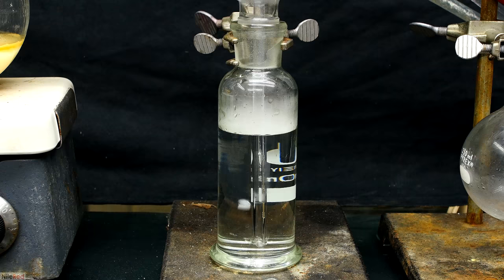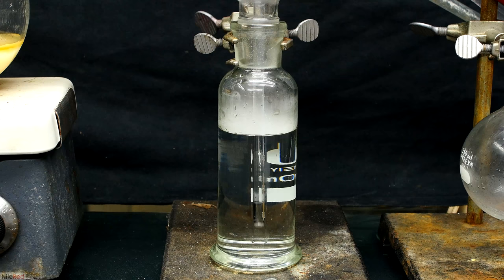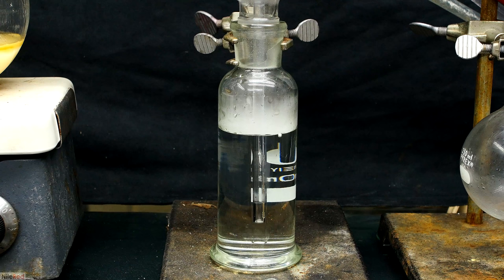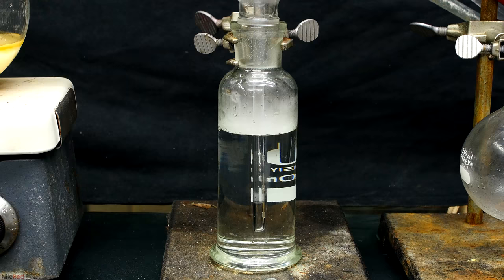Above concentrated hydrochloric acid, there's a decent amount of hydrochloric acid gas, and when the trimethylamine is released into it, it reacts, forms finely dispersed trimethylamine hydrochloride, which falls back down and slowly dissolves into the water.